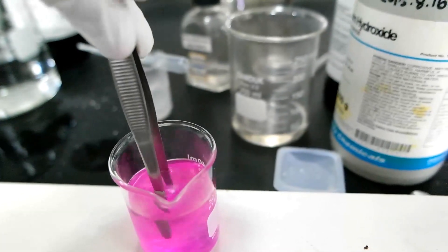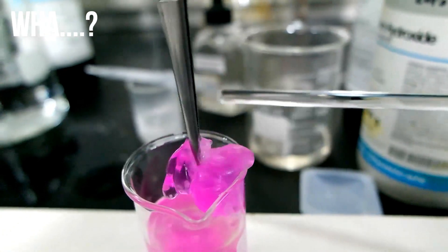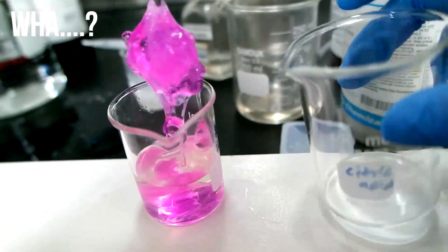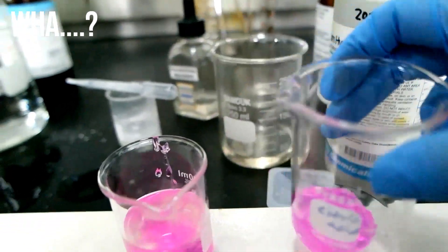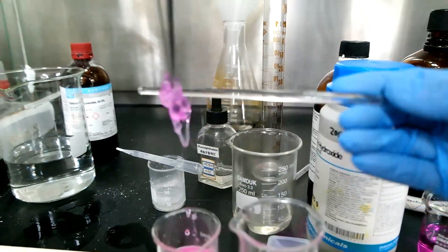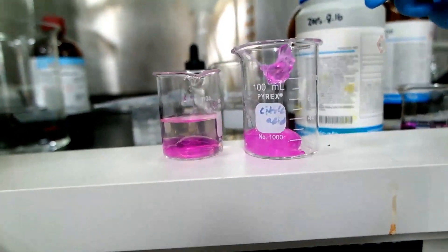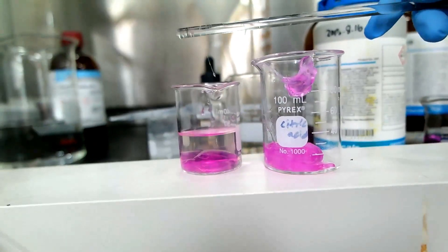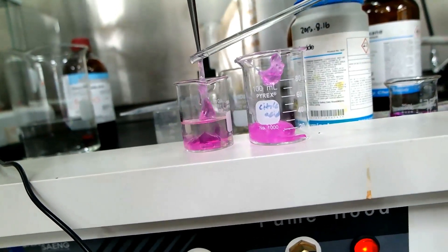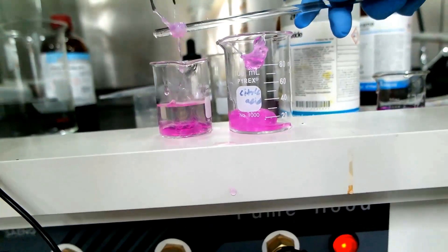Woah! Let's take the big chunk here — and then let's pick up another strand. Okay, this is awkward. Oh my god — there's the nylon! Wow, why is this happening? I see some strands. We'll try to modify it. It popped — be careful. I think it's not mixed properly.